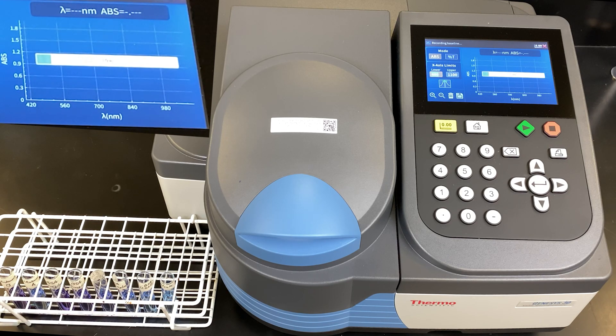What it's doing now, it's blanking every wavelength we've selected. It can take some time to blank the entire range you've selected. However, it will provide data points for every wavelength along the way. Much faster than going through and doing it one at a time, collecting it that way.